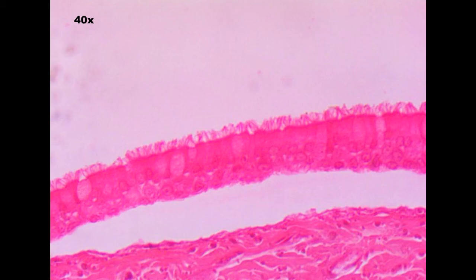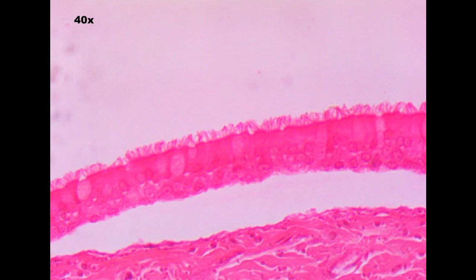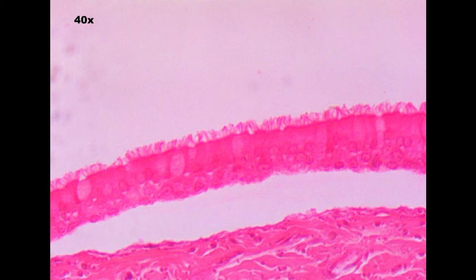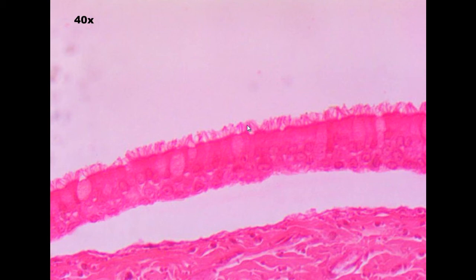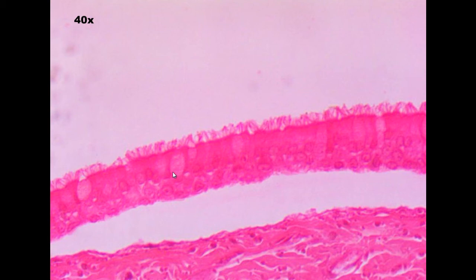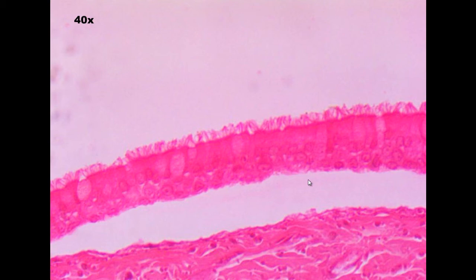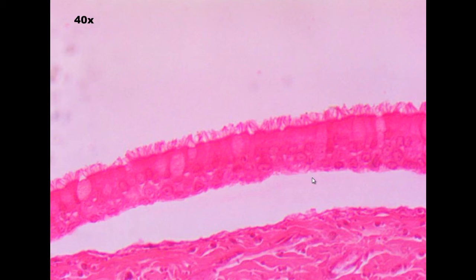In this video I'm actually going to walk you through this quiz and show you how I would key these things out so that I can identify them accurately and correctly. I won't do this on the other quizzes, so you'd have to watch this one first. Now this first one — looking at my key, does the tissue have cilia? Absolutely. Does it have goblet cells? Absolutely. Do we see a distinct band of nuclei? Nope. That means it's got to be PCCE.